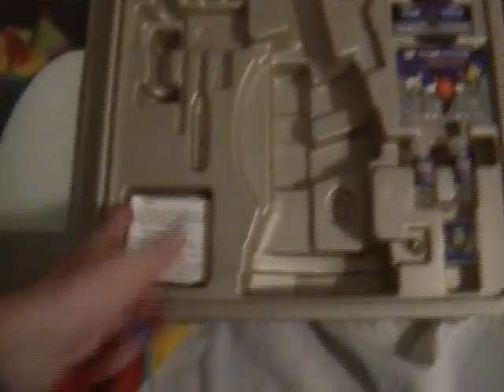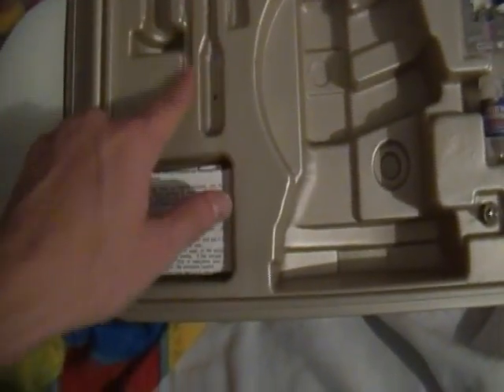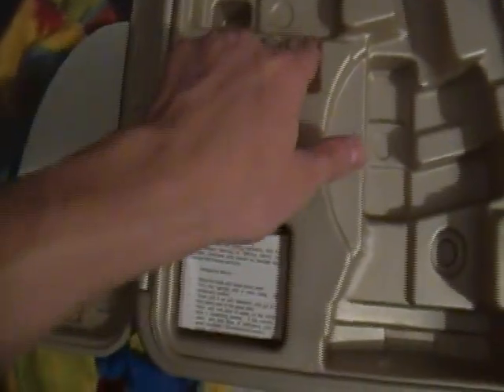So, before I burn up the entirety of that battery, I'm going to show you what all came in the box. Of course, half of it's missing, but I did come with instructions. It originally came with a test tube, a stirring rod thingy, an eyedropper, and a screwdriver. Presumably for taking that screw out, all of which have been lost.